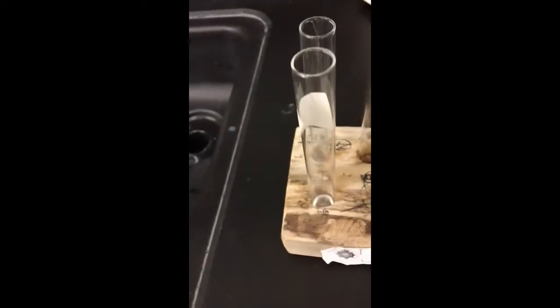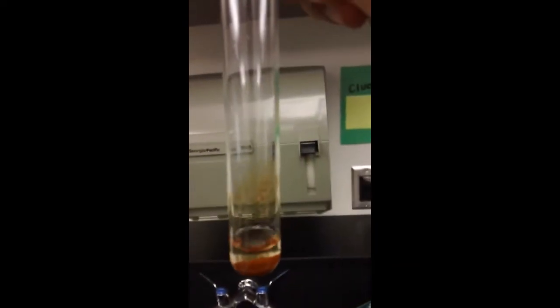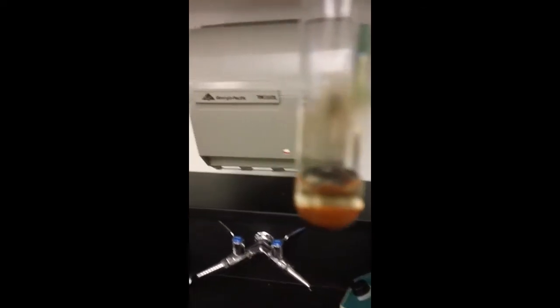Okay, so here we'll go. This is Cr, no solid, so I keep it for step 3. Now here I double check. Notice how I do have a solid here. Okay, so this is my Fe. I do have a solid, and I know this is kind of hard to do with only one hand and one's holding the videotape, but I'm going to remove the liquid from the solid.